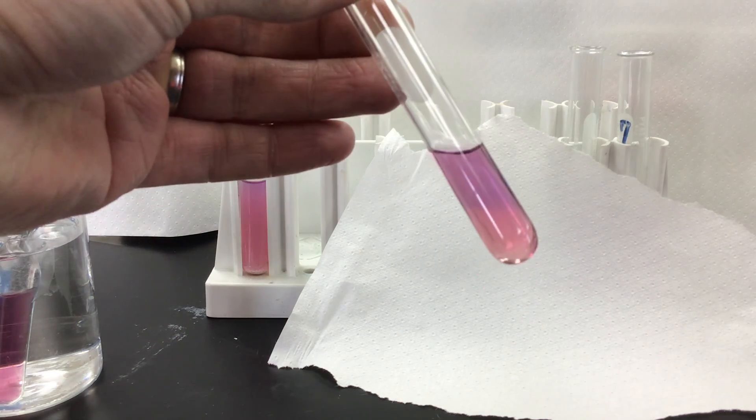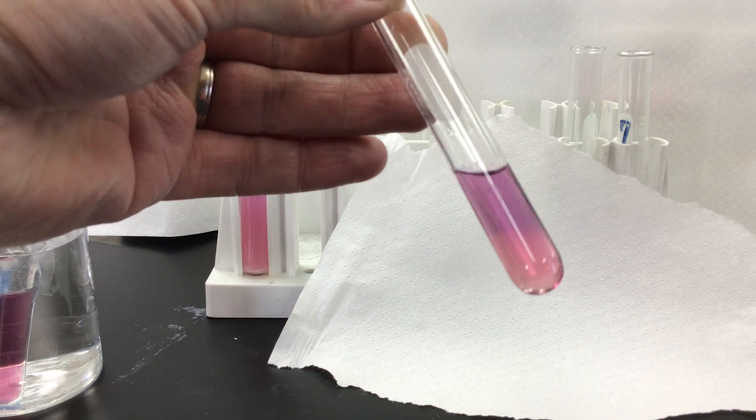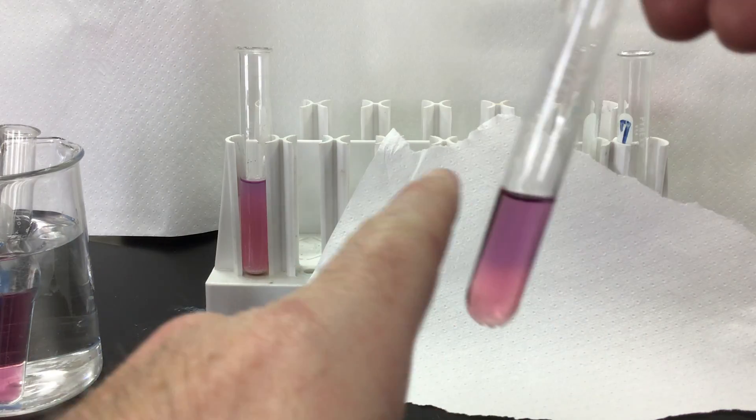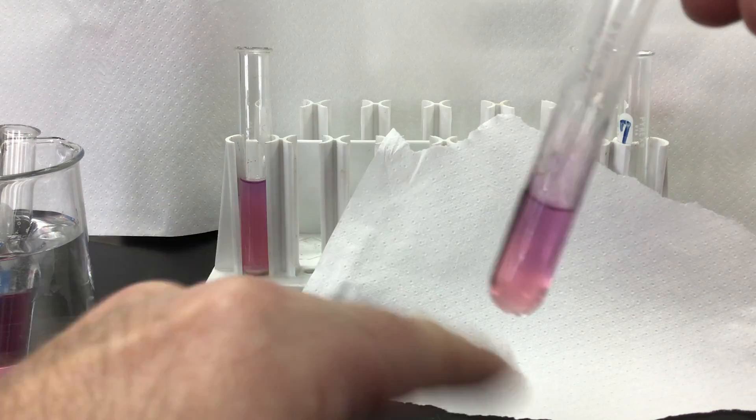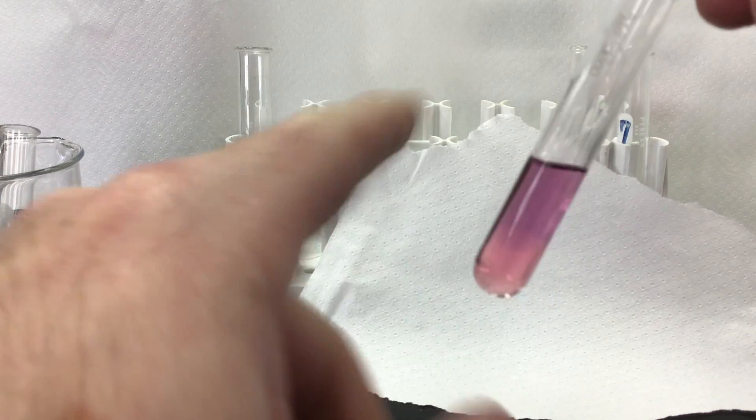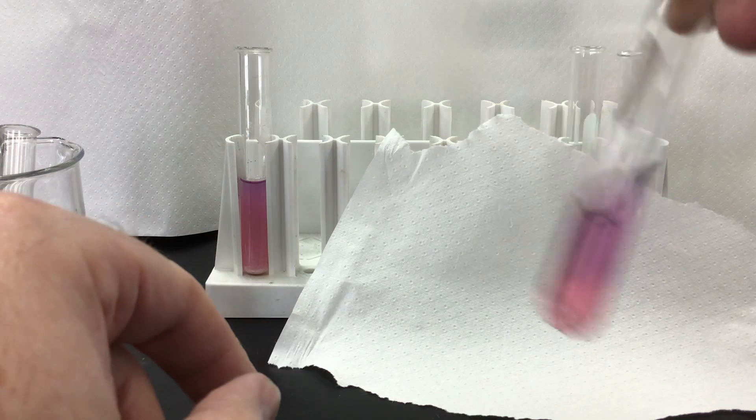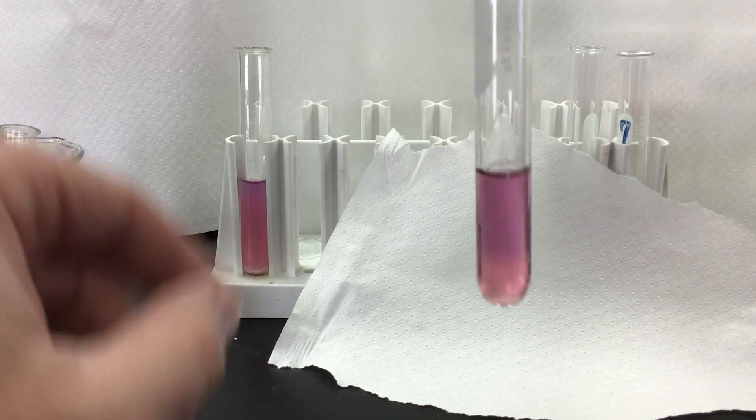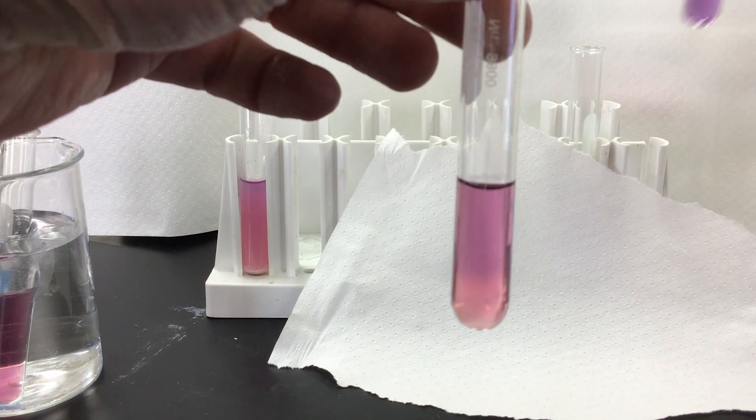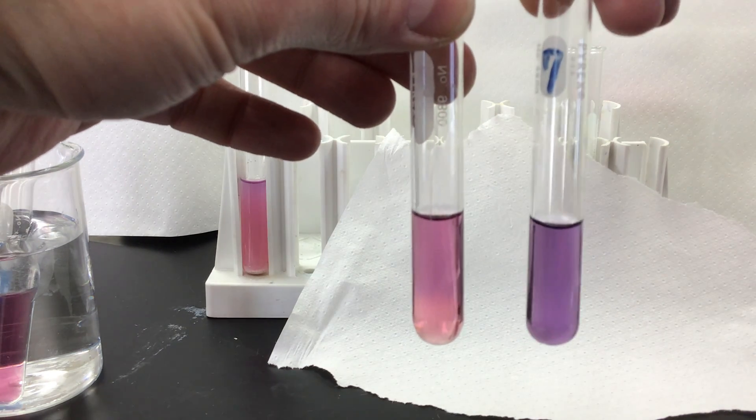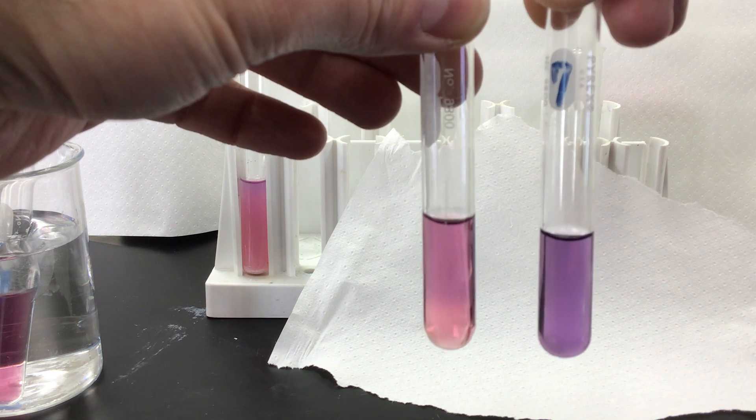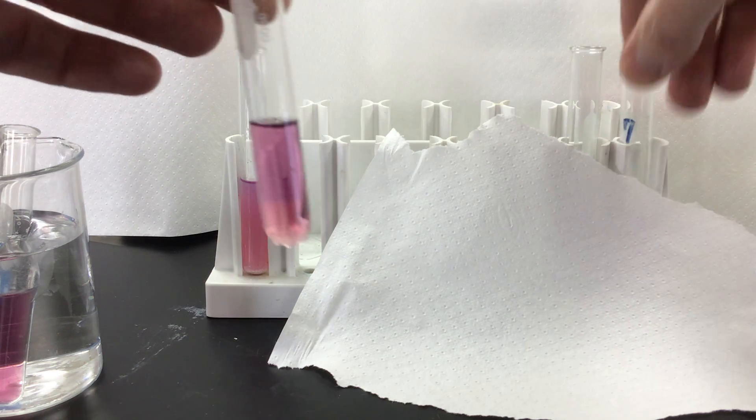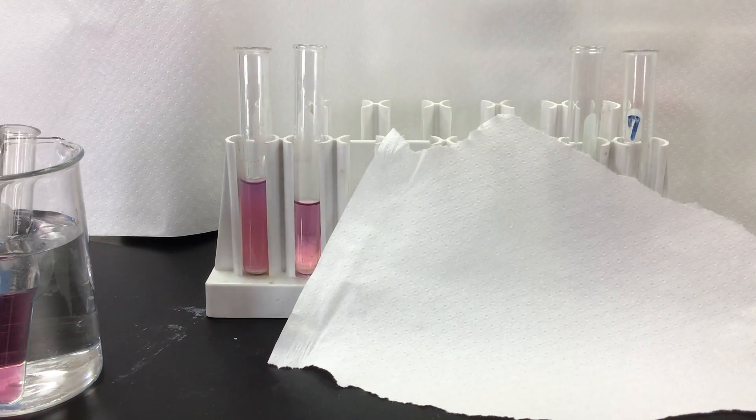Hopefully you see the water is kind of settling at the bottom there. Definitely kind of turning a lighter pink. I'm just going to kind of agitate it. You can agitate a test tube like this in case you don't have a stopper to mix it. And definitely turning pink. Here is my solution on the right. In contrast, the one on the left is definitely turning pink. So turned pink with water.